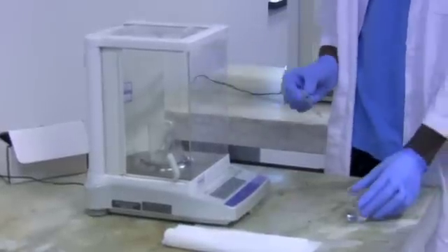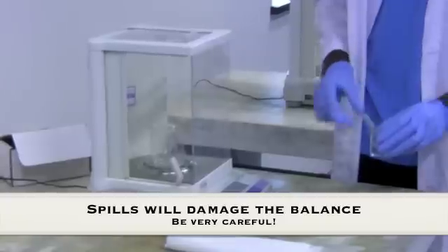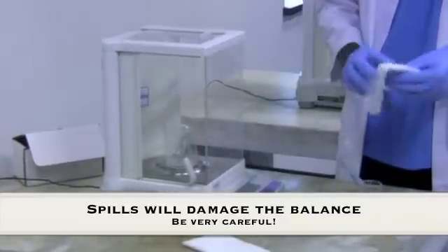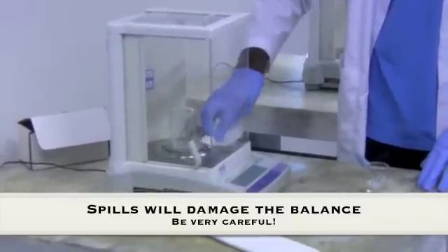When you're doing this, make sure not to spill any of the hydrogen peroxide inside the pan. And if you do so, have a tissue handy and clean out the inside of the pan.